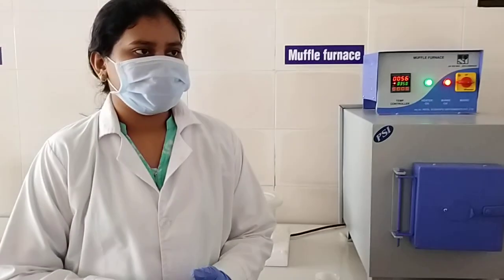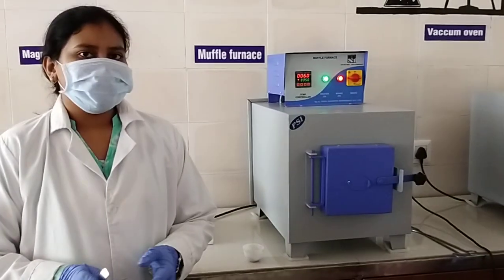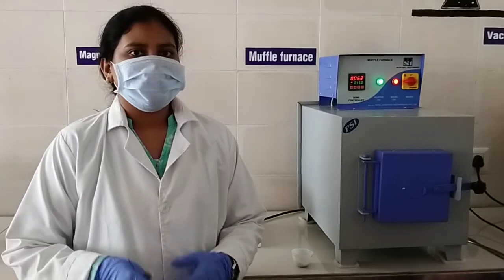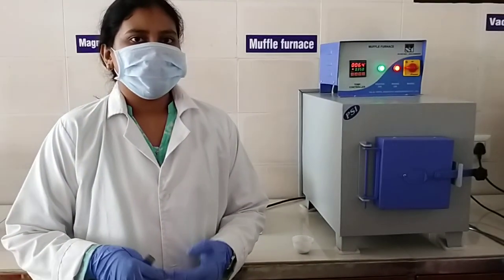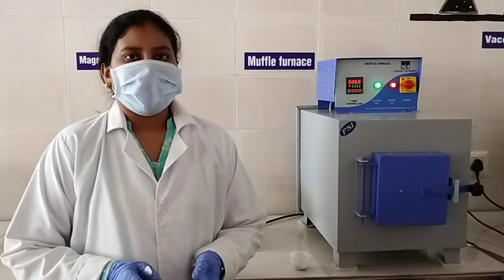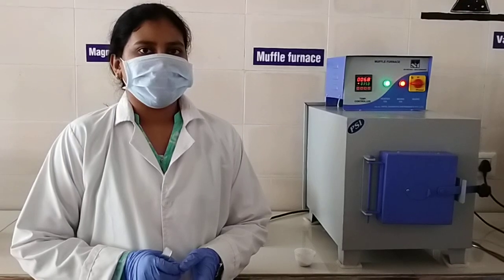Yes. I think the green method is easier and simpler. It is a very reliable method as compared to the chemical method, because during chemical synthesis many harmful and toxic gases are emitted, and so many chemicals are required. So here I choose green synthesis.